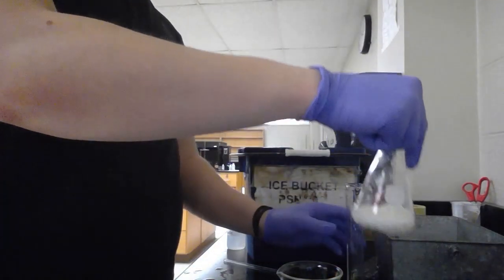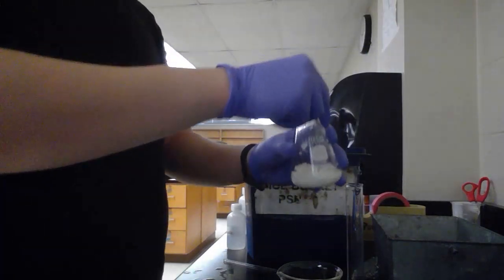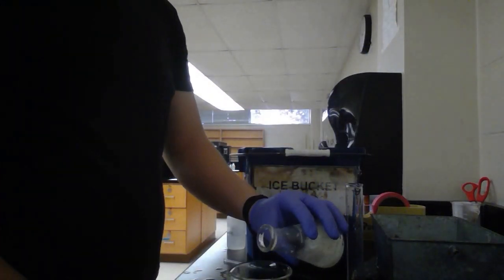Now we're going to wash the soap with 20 milliliters of cold water, and then decant that and rinse into the waste beaker.